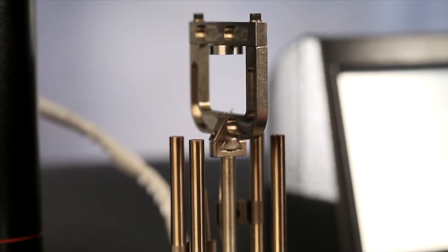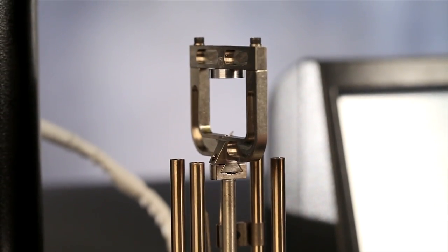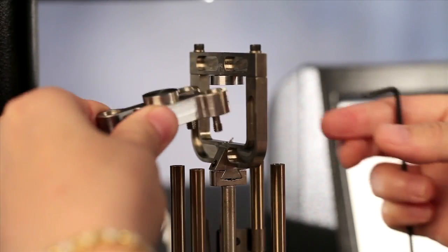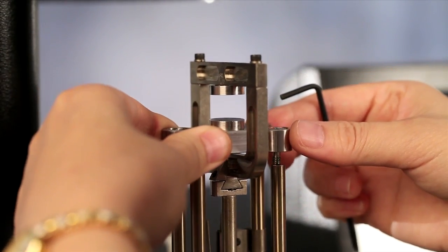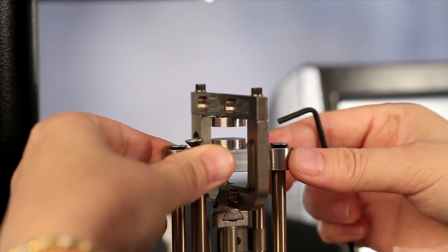After the mass calibration, install the stationary clamp to the instrument.